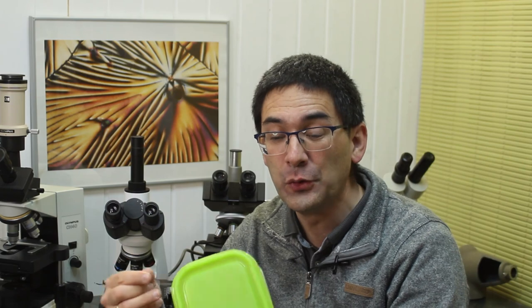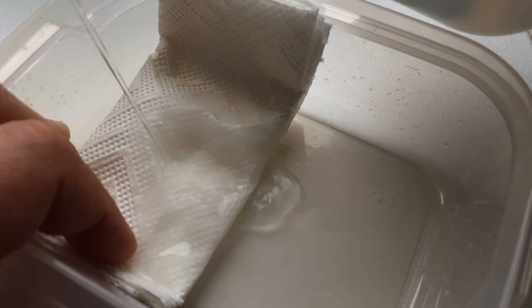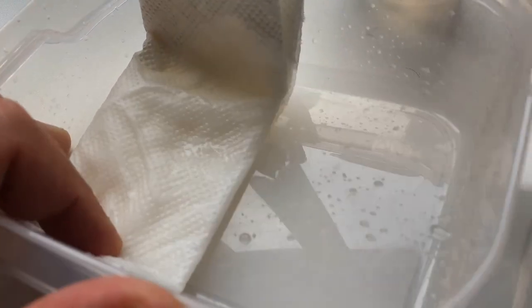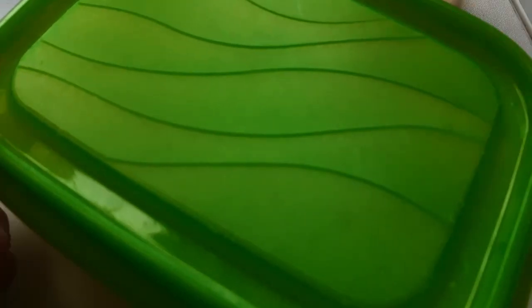So then the humidity is going to be 100% in the box, and then the water is not able to evaporate. Now, of course, you do not want the water in the box to go on top of the microscope slide. So what I've been doing in the past is I always added a little bit of wet tissue paper into the box here, and then I put the slides on the other side of the box. And this is possible, but it's not, I would say, the most elegant solution, especially also because there is still the danger of water going on top of the slide.